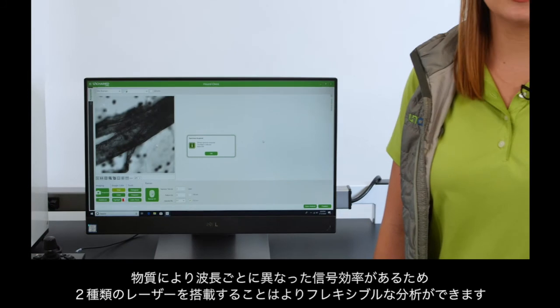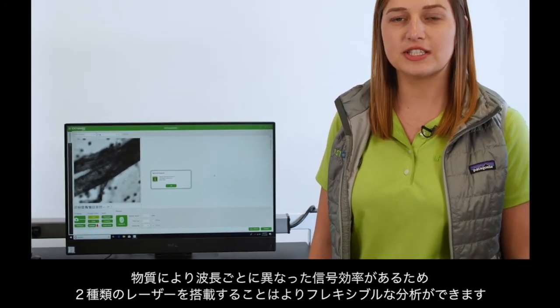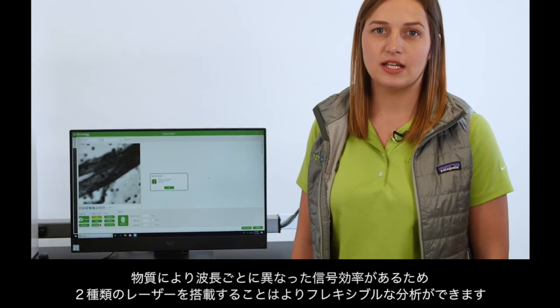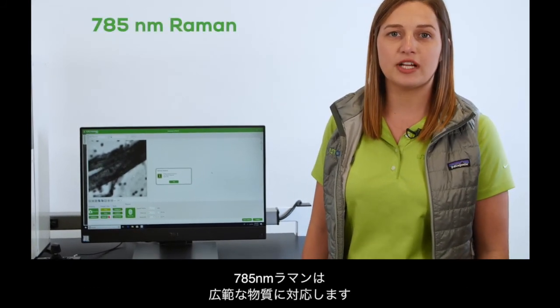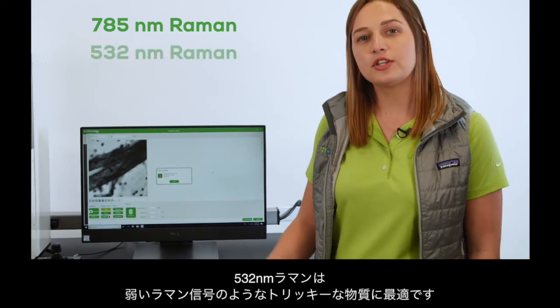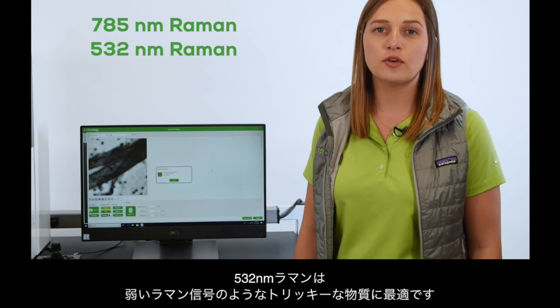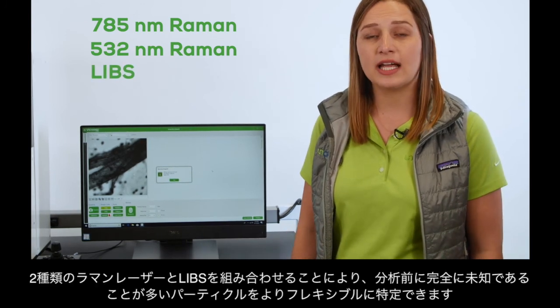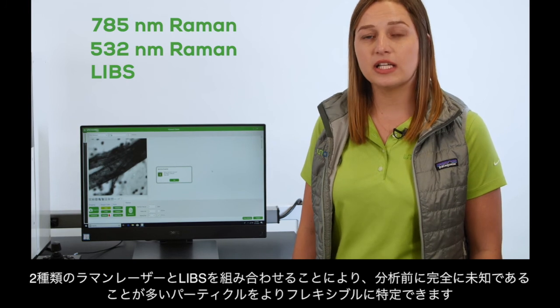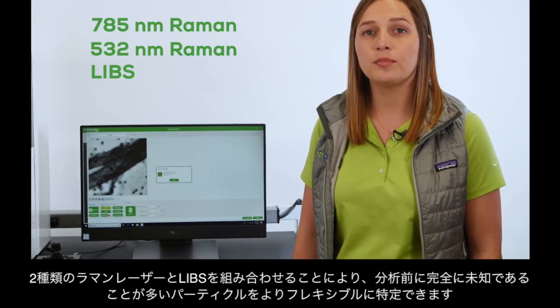With the two lasers, I have better flexibility because materials have different signal efficiencies at different wavelengths. 785 nanometer Raman is versatile for a wide range of materials. 532 nanometer Raman is great for those trickier materials that have a weaker Raman signal. Combined, dual Raman and LIBS gives me the flexibility I need to identify particles that are often completely unknown before analysis.